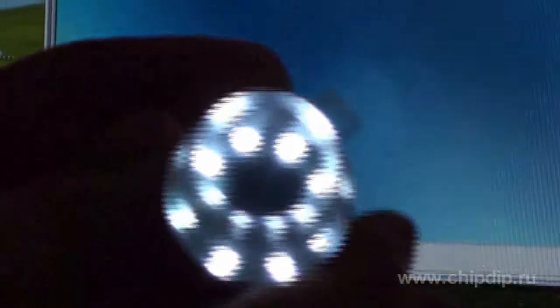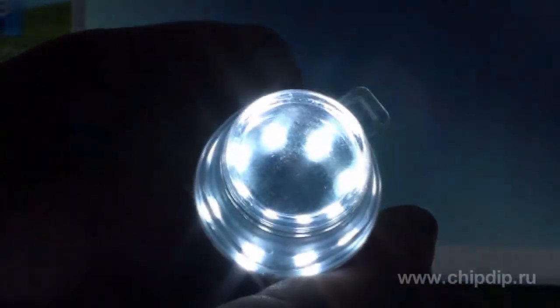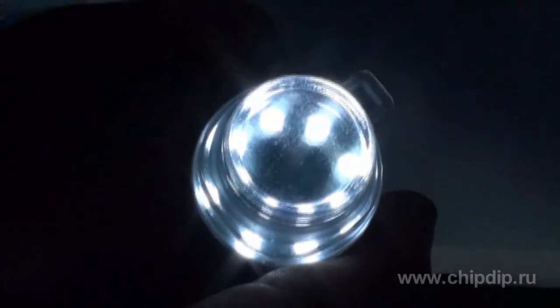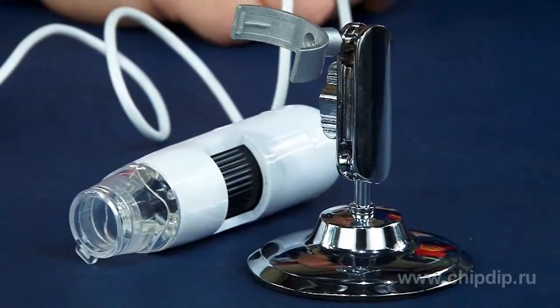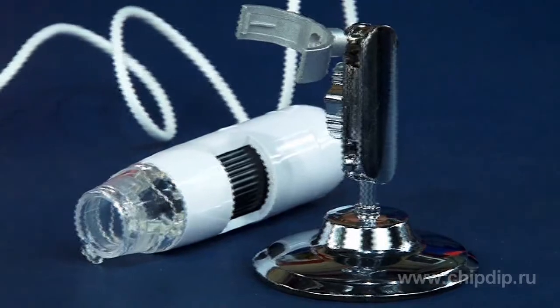The device has a light source consisting of 8 white LEDs. The microscope is powered from a USB port. The delivery set also includes a compact stand which allows you to work with the microscope on a table.